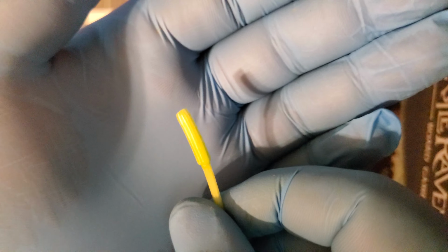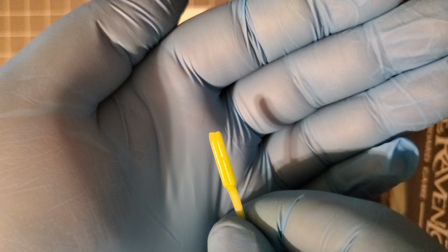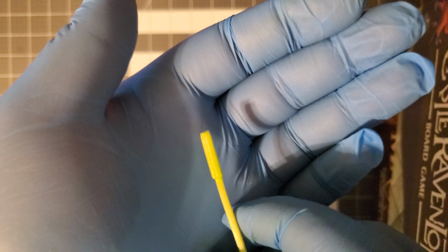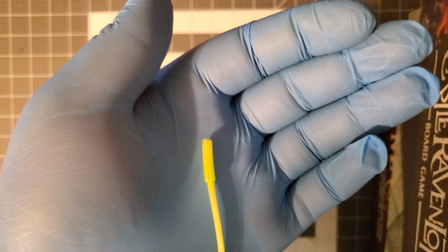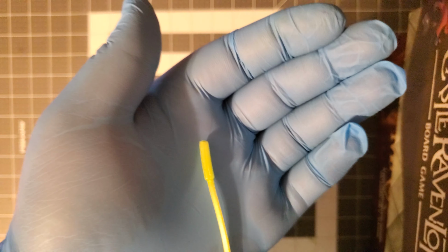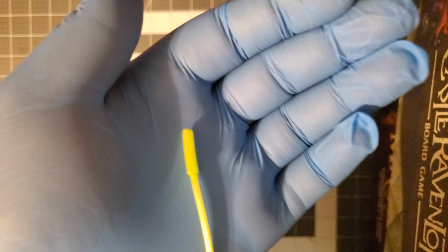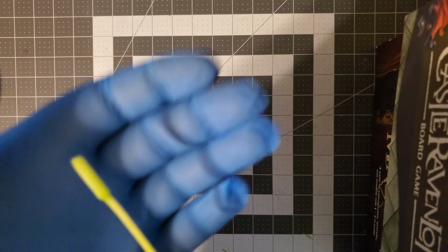So this is the ovary, and it does have multiple lumps, so multiple ovules. If I were to cut inside the lumps, they should contain those diploid cells that go through meiosis and create the female gametophyte, if I'm saying that correctly, which houses the egg. The anthers mainly have the sperm, going through the male gametophyte and the pollen grain, if I recall correctly.